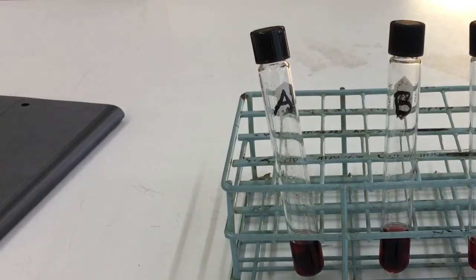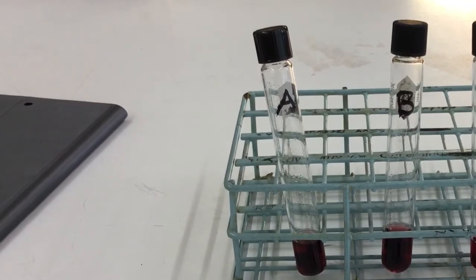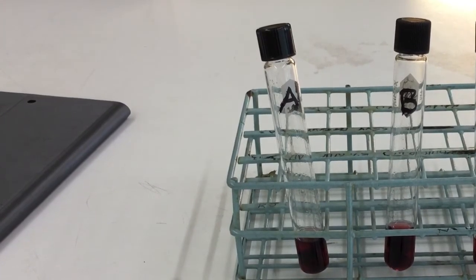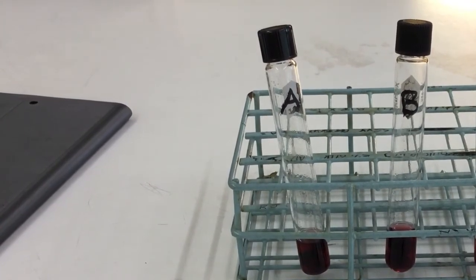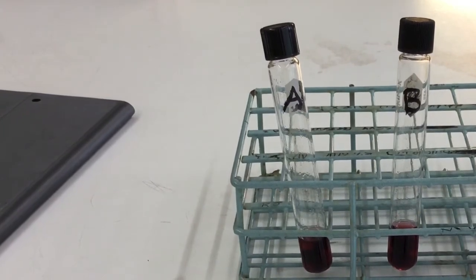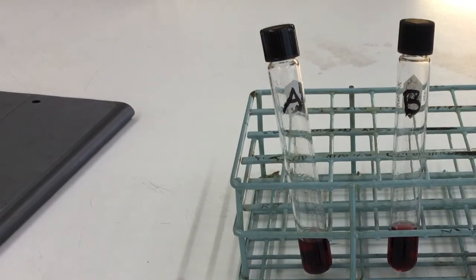Okay, so four test tubes were labeled A, B, C, and D, as you can see here. These four test tubes were rinsed with distilled water, then with a small amount of bicarbonate indicator. And then in between, while I was getting ready, I kept the tubes tightly stoppered whenever substances were not being added. You should try to think about why that would be.